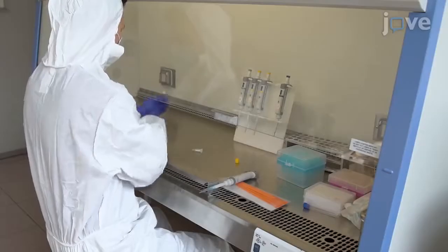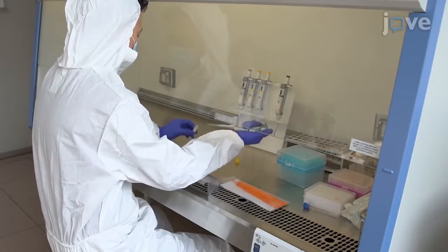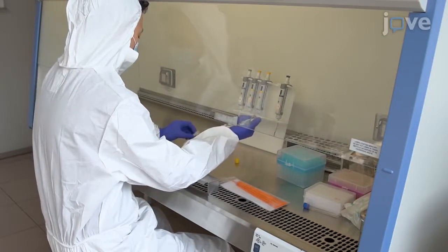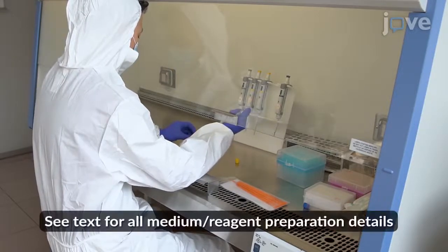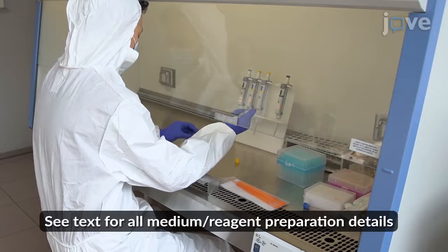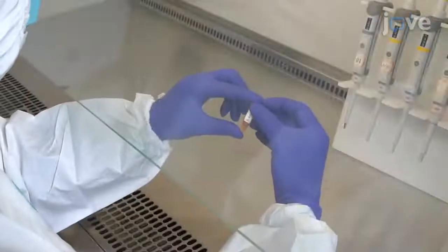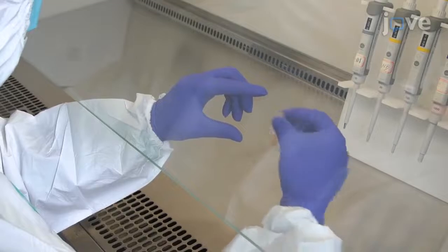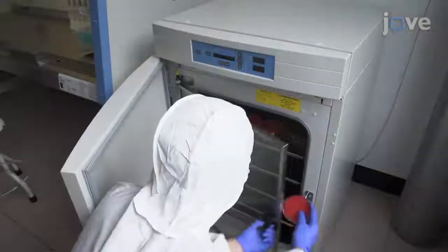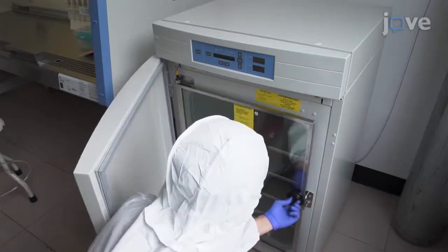To prepare the bacterial suspension, first dissolve 0.5 milligrams of S. aureus freeze-drying powder in 0.3 milliliters of LB culture medium. Mix the suspension thoroughly and streak the bacteria onto tryptic soy agar plates for incubation for 16 hours at 37 degrees Celsius.